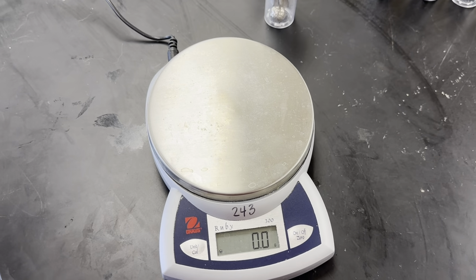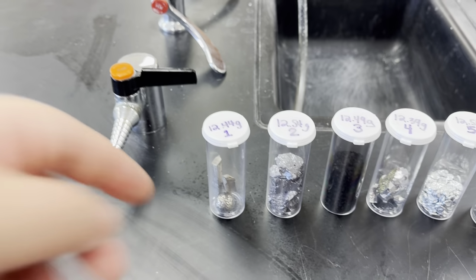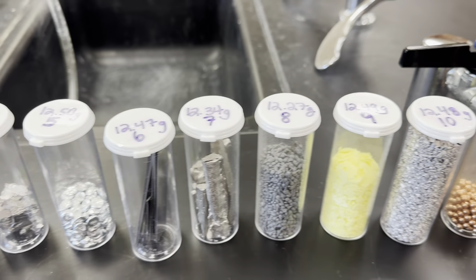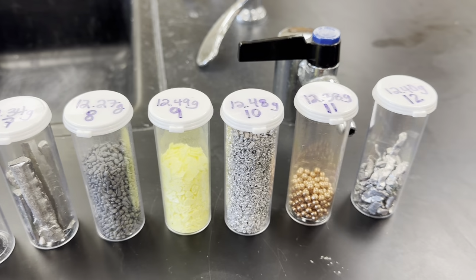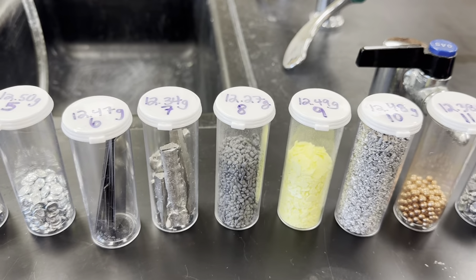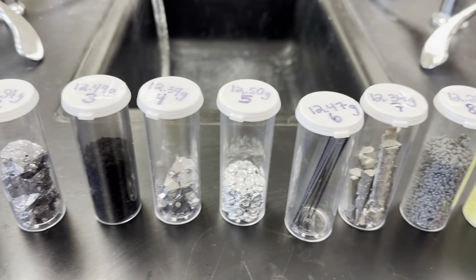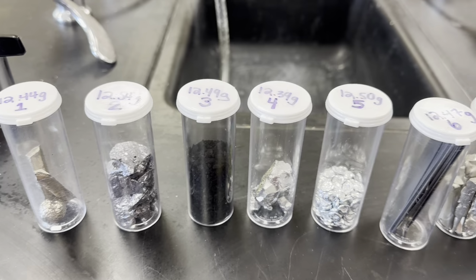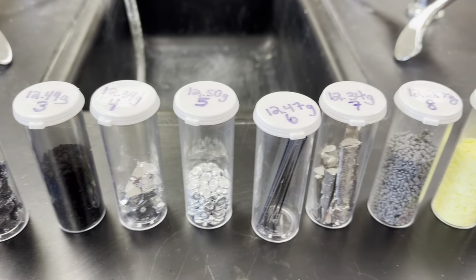All right, this is for the mole lab. So a mole, each of these containers contains 1 mole of atoms of a single element. So that means each container is going to hold 6.022 times 10 to the 23rd atoms of whatever element is inside. So they all contain the same number of particles, but what you're going to see is they all have different masses.